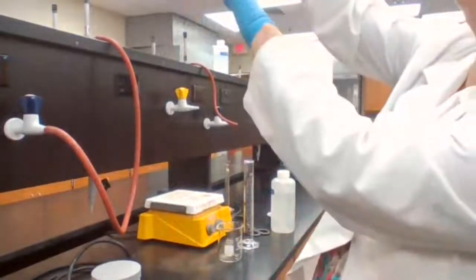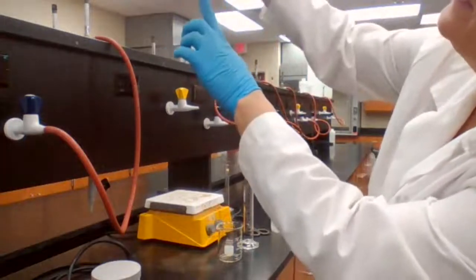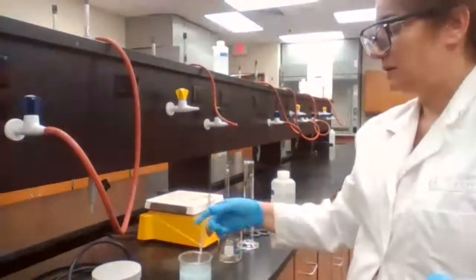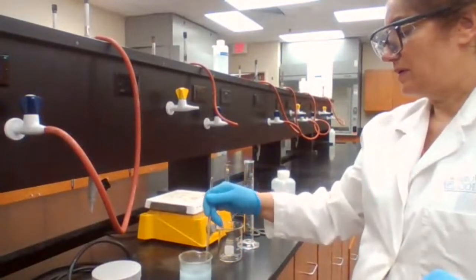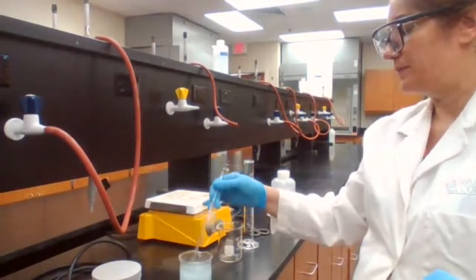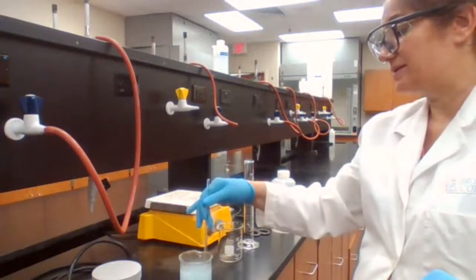I added some water to see if I can see any magnesium left. I don't see any magnesium left. So because no magnesium is left, I can wait for bubbles to stop, or I can decant and move on to the next step of the experiment. But what we want to make sure is that all the magnesium has been reacted.